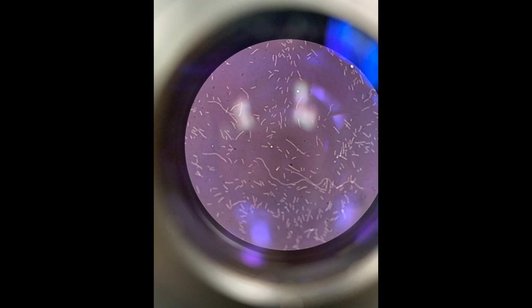And so negative staining is really useful to allow you to see extracellular structures. Sometimes you can see flagella, sometimes you can see capsules this way. This also is really helpful for seeing really small or thin bacteria, because you'll have more of a void where the microbes have excluded the stain.